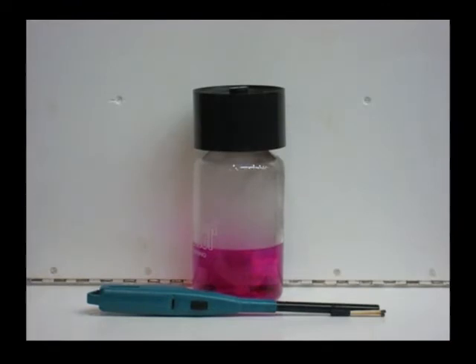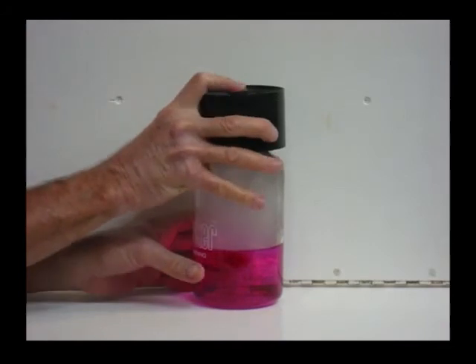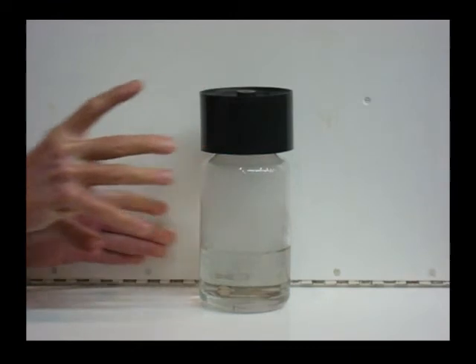The sulfur in the match heads forms sulfur dioxide upon combustion. One quick shake of the flask will show the acidic reaction of sulfur dioxide when it reacts with water.